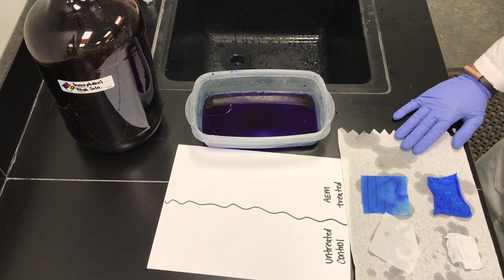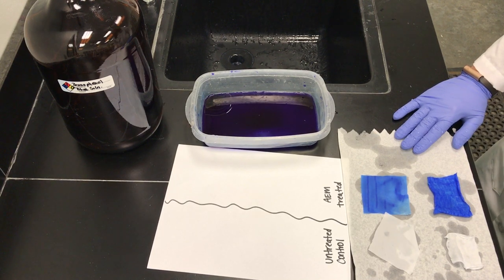The BPB staining is very substrate specific, so the intensity of the blue stain can differ from fabric to fabric.